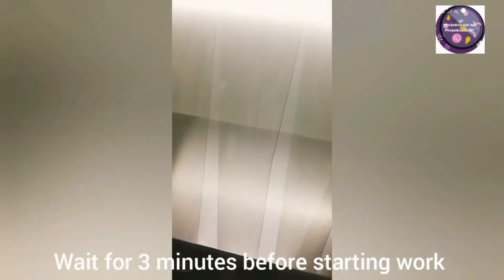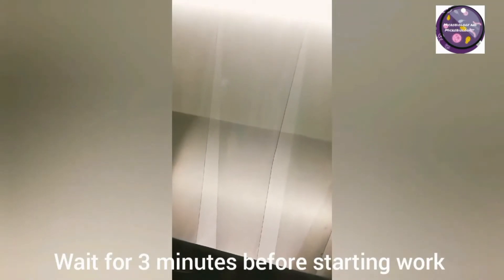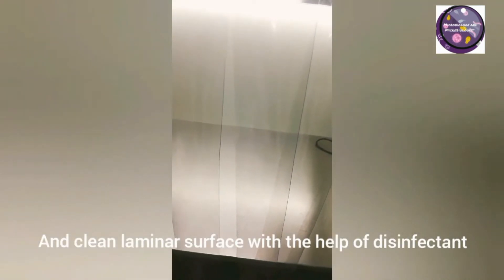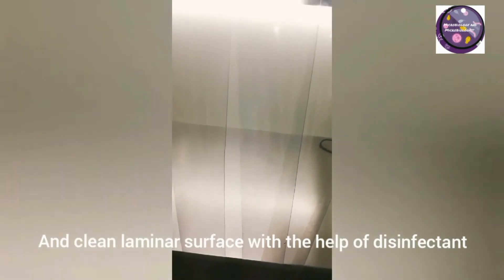Wait for three minutes before starting work, and while waiting, clean the laminar airflow hood with 70% isopropyl alcohol or any other suitable disinfectant.